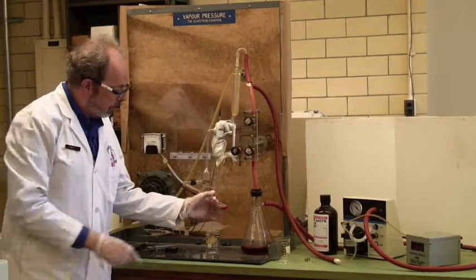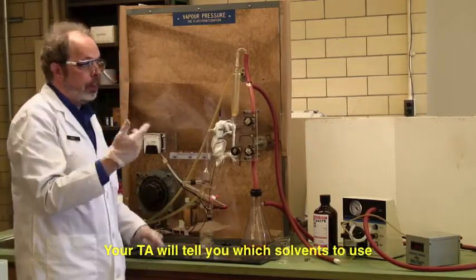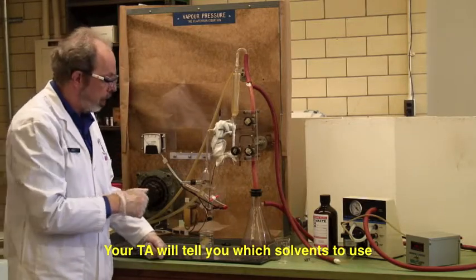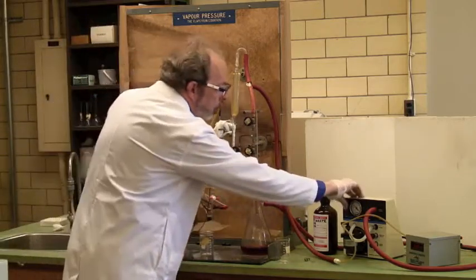I'm going to fill this. I've got a beaker. This is actually methanol. You will be using other solvents from the yellow cupboard down at the end of the aisle. Shut this off and turn the pump on.